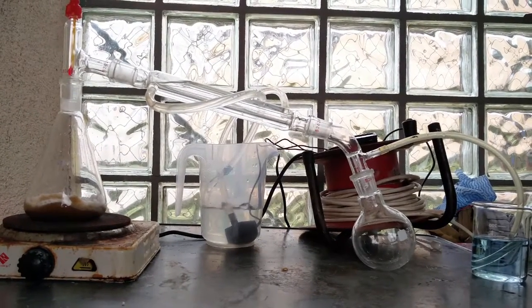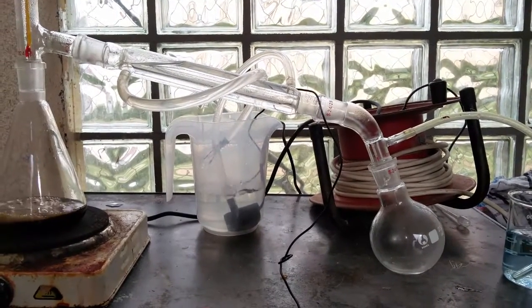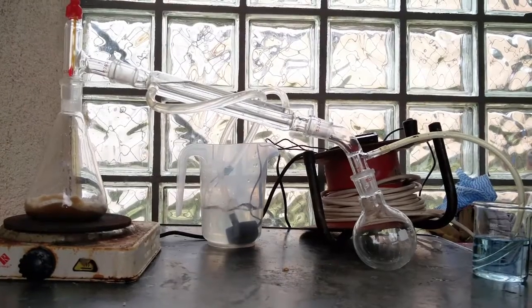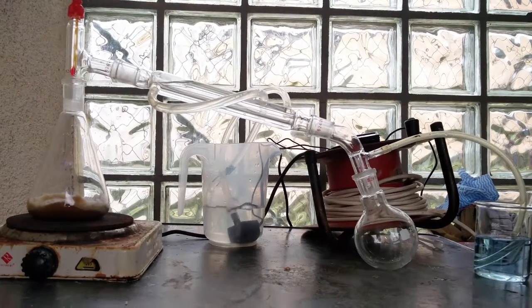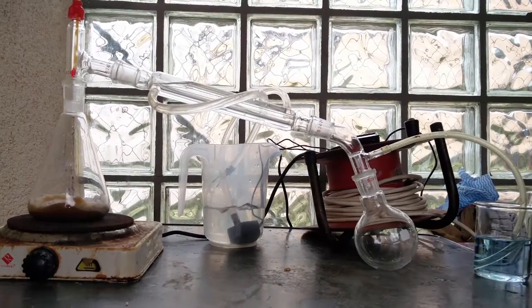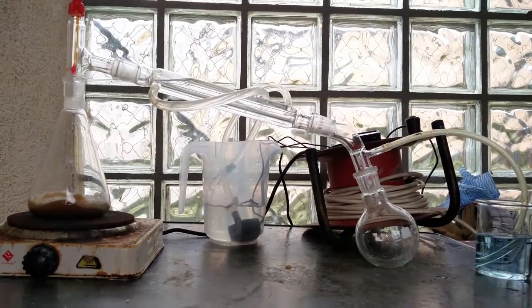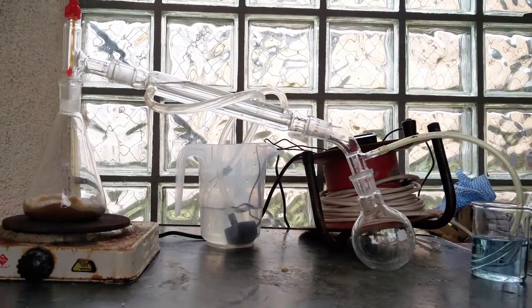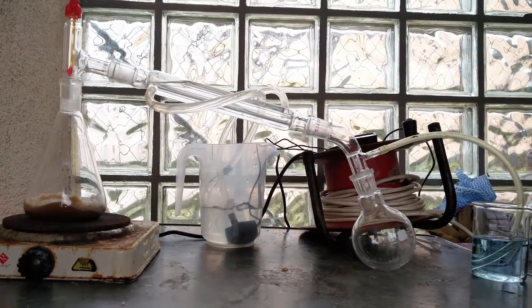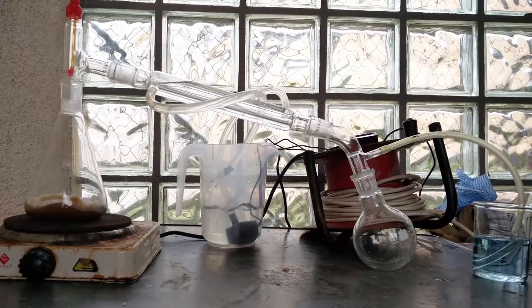Then set up for simple distillation — we are going to distill the weak formic acid off the mixture. On top I added a thermometer to see the temperature of my distillate. I also attached a Liebig condenser and turned on the water cooling. Since the mixture is going to boil at about 100 degrees Celsius, you don't need ice-cold water; room temperature works very well.